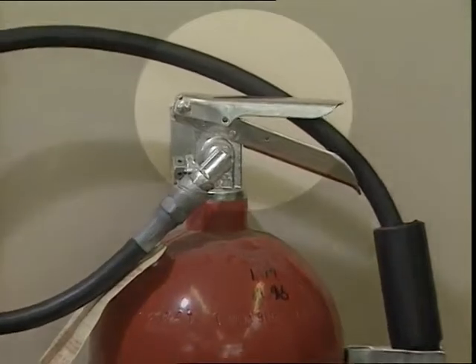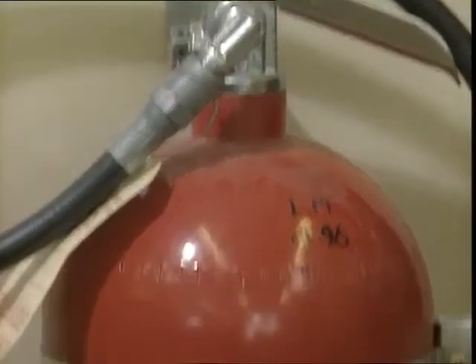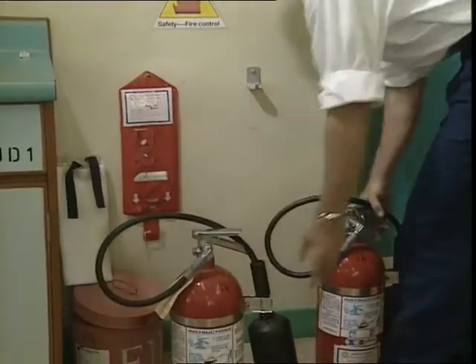If the safety pin is broken, or when the fire extinguisher has expired, arrangements should be made to replace it with a new one.